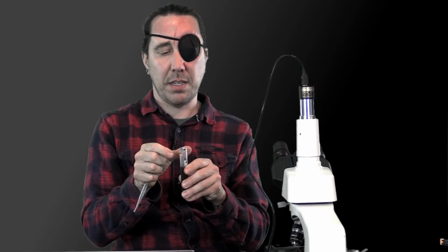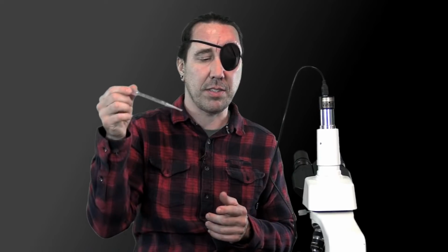If you've got big chunks in your pipette that are coming out into your drop on your microscope slide, it's going to impair your putting the slide cover on there, and you'll have to get that out of the way or start over. So that's the reason that I do that. And I'm just looking through this to make sure it's clean.